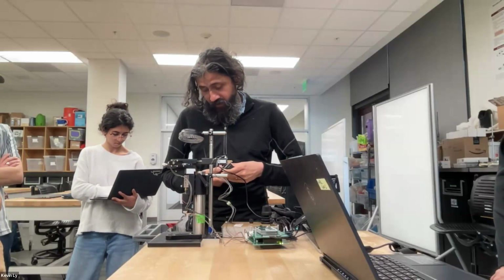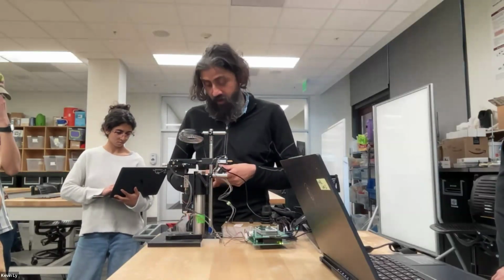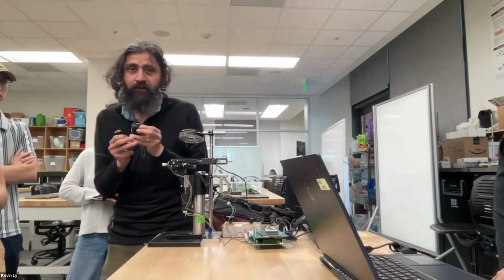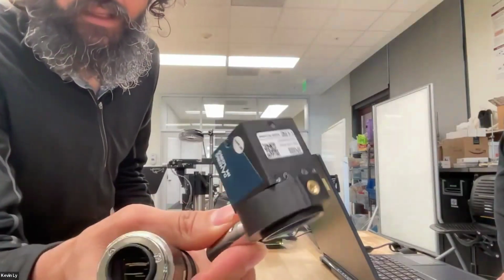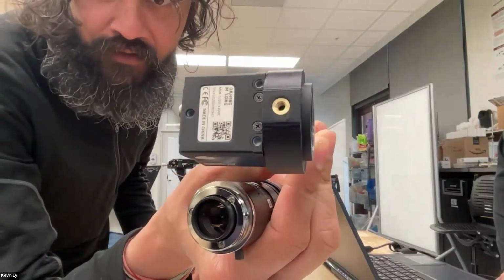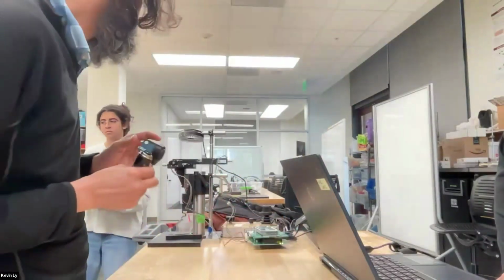What we ended up finding also is drivers are a massive pain for cameras and threads. So now we actually use this as the primary camera for all our imaging things in the lab. So I'll just show folks in here. This happens to be, and the reason they are so cost effective is because there is a mass production market for each one of these cameras.